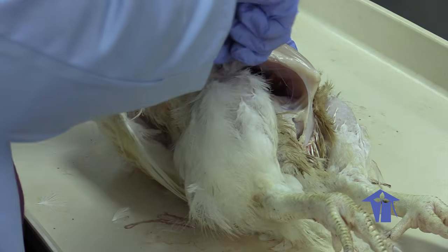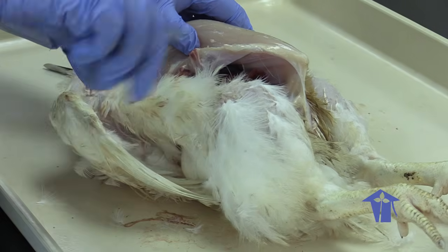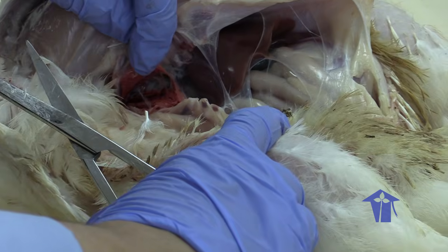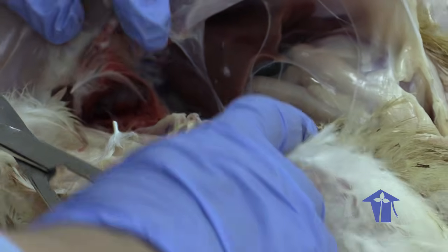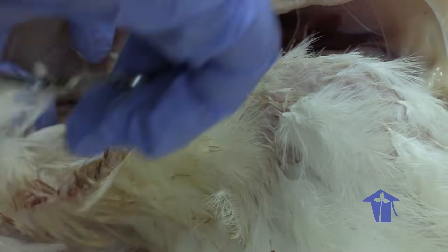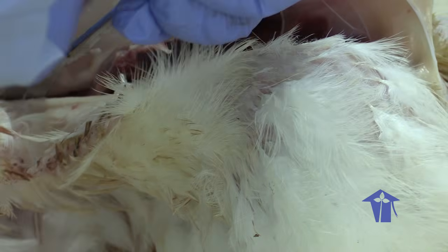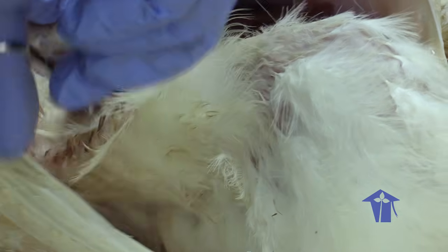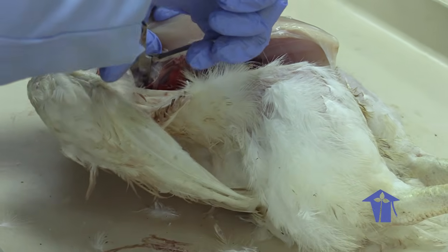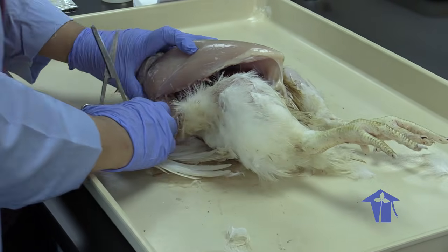Okay, so that was some lung. This very red, dense structure that you see here is the lung. And remember from last year, we said that the lung is not like our lungs that stretch open. It basically is a structure that is densely packed against the ribs, and its sole function really is just to get gas exchange to happen. The ventilation in the chicken happens via the air sacs.